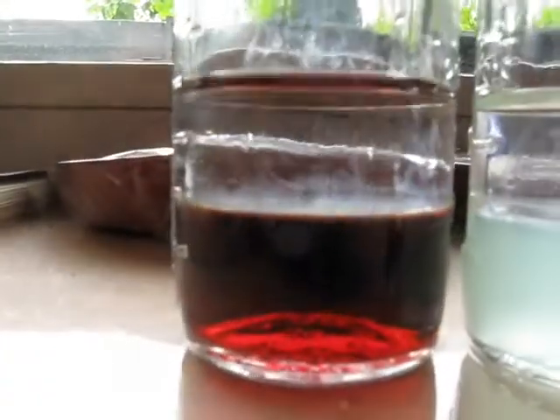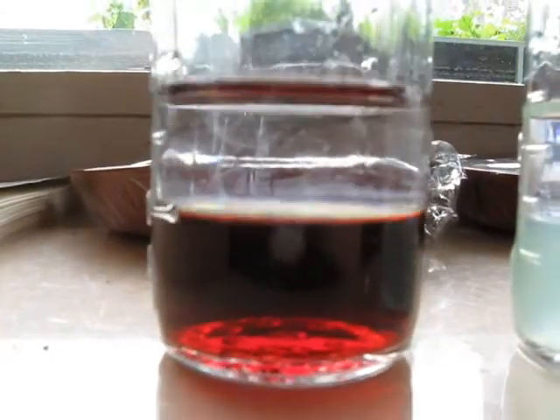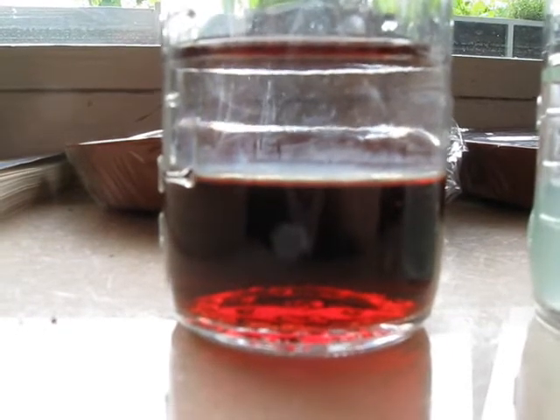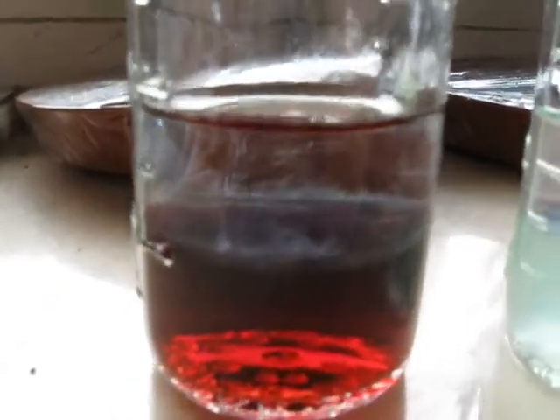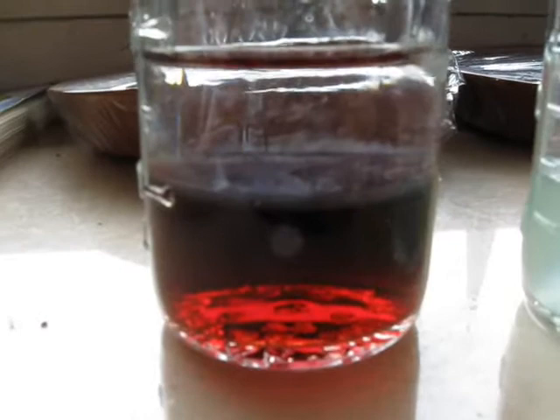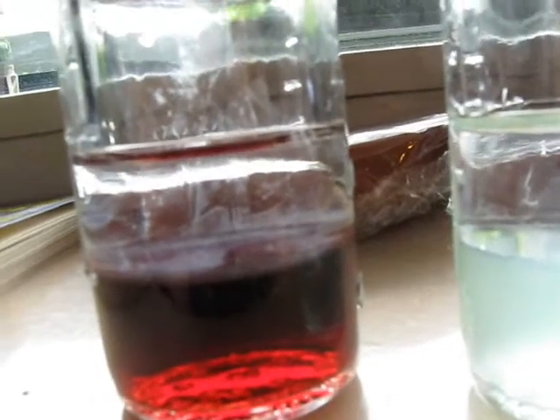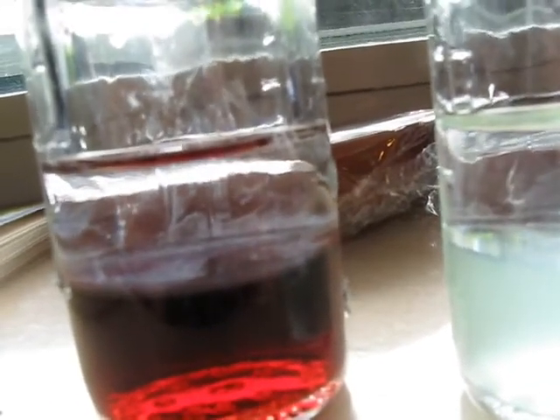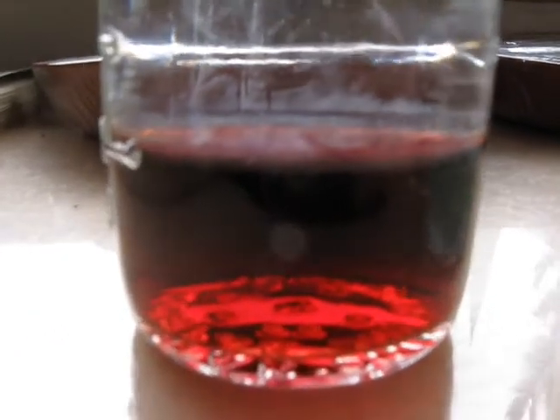But look in the blood vial — there is not much happening. The thing is that blood mostly consists of water, and even the red blood cells, the erythrocytes, do not have a nucleus, so they do not contain DNA. The only cells in the blood that contain DNA are the white blood cells. The problem is that there are just too few cells in this amount of blood — you would probably have to extract the white blood cells first.